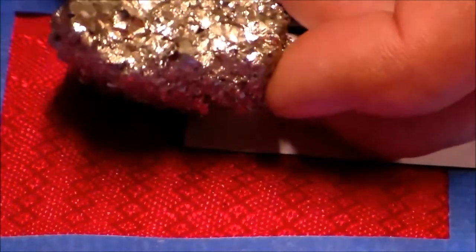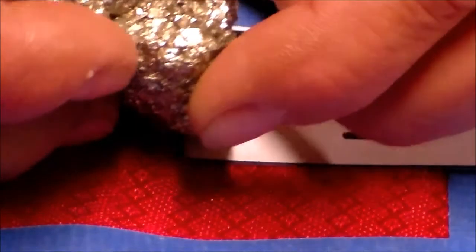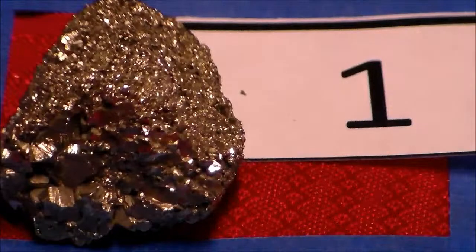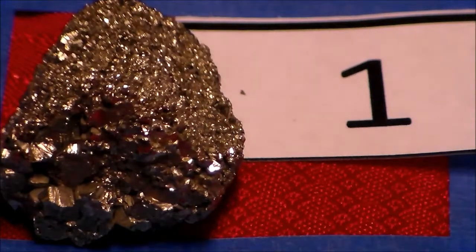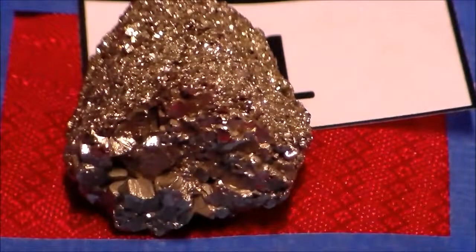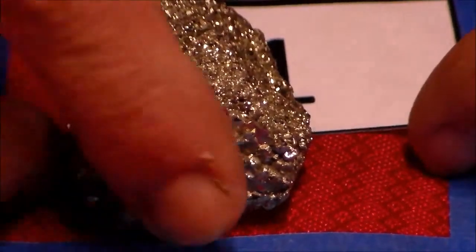I'm not sure if you can see, but there's a lot of cubic crystals all forming together here. They're little tiny cubes. And hopefully that's enough for you to kind of get an idea of what mineral sample 1 is. Look it up on your mineral information table and document 2 other properties that helped you identify this mineral: the mineral name and a common use. And that's what you'll enter in e-learning.